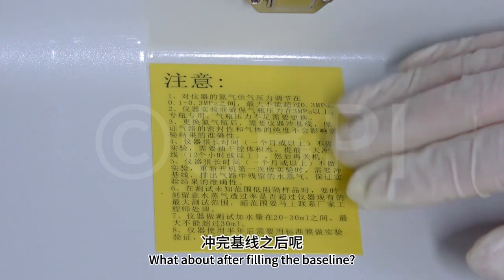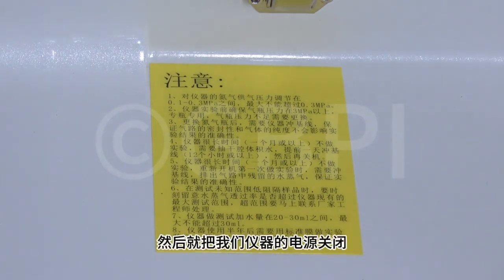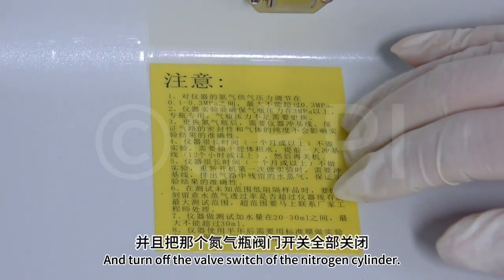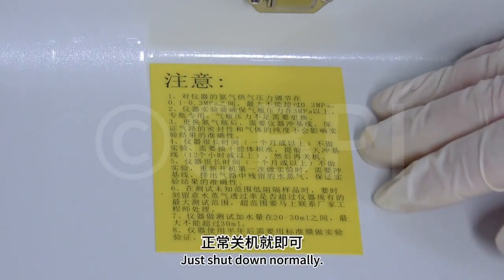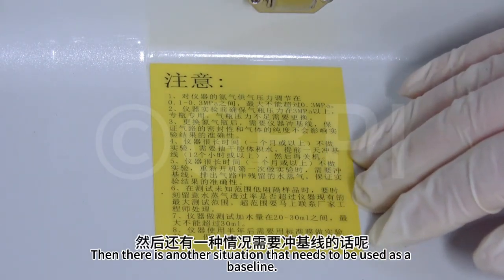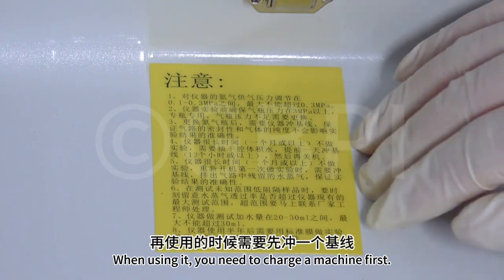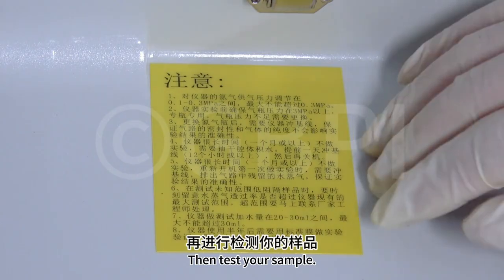What about after filling the baseline? Our cover does not need to be opened. Then turn off the power to our instrument and turn off the valve switch of the nitrogen cylinder. Just shut down normally. Then there is another situation that needs a baseline fill. That is to say, if the instrument is not used for more than a month, when using it, you need to fill the baseline first. Then test your sample.